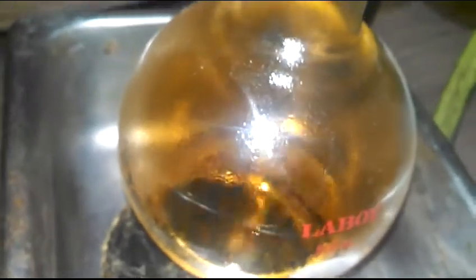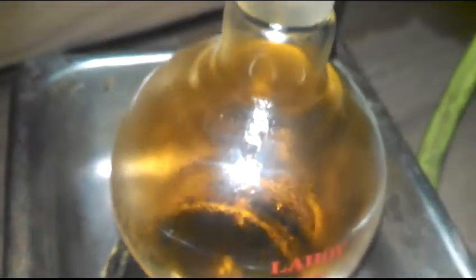It's cleared right up. Still a little bit of NO2 left in the bottle, but I'm hoping that acid isn't gonna be super super yellow. It is, I know it's gonna be super yellow.